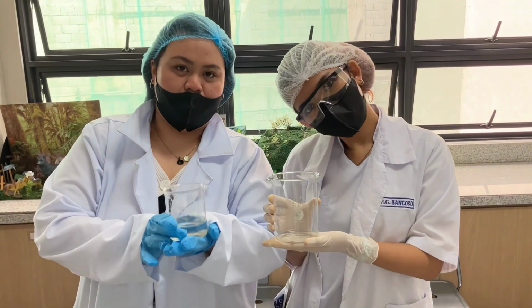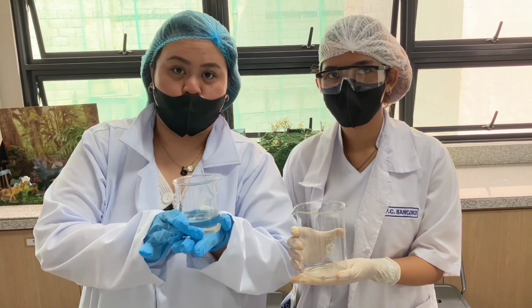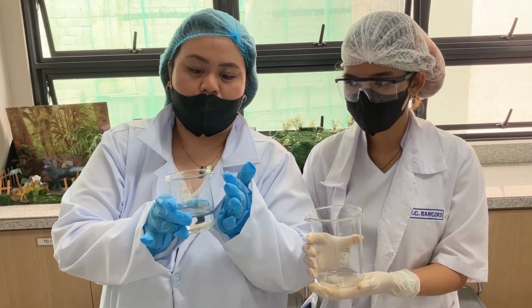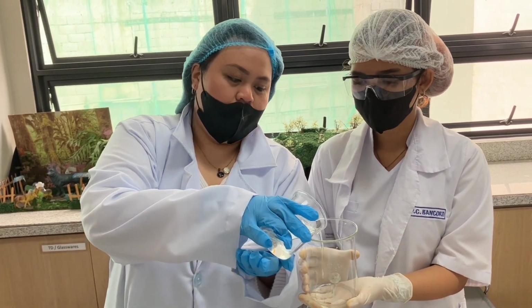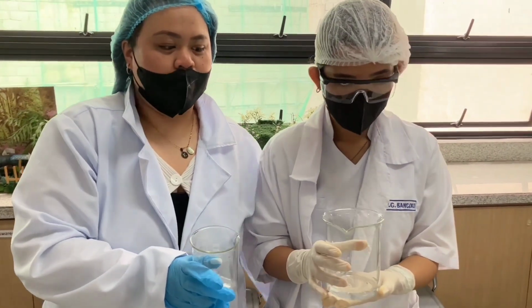Hello there, we have here the beakers. These beakers are glass containers which are used to hold liquid or solid samples. They have a lip opening which allows us to seamlessly transfer the sample from one container to another. My friend here will discuss the function of the beakers.